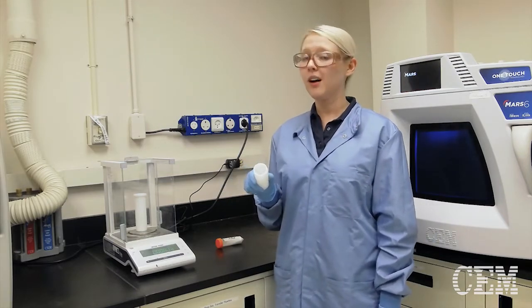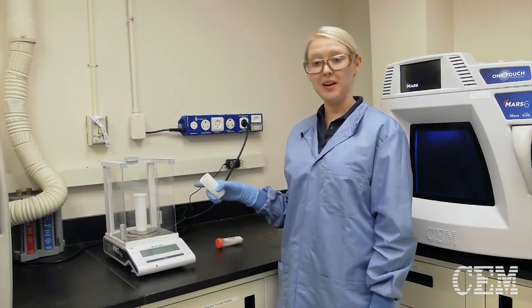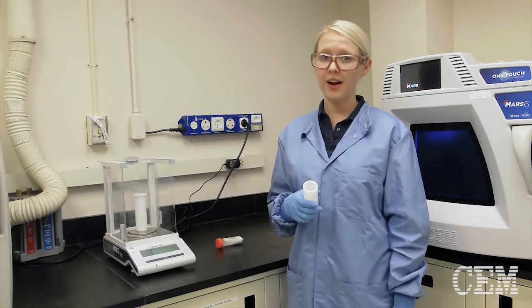As you can tell, this PVC will not fit into my vessel. So in order to do that, I have to grind it.